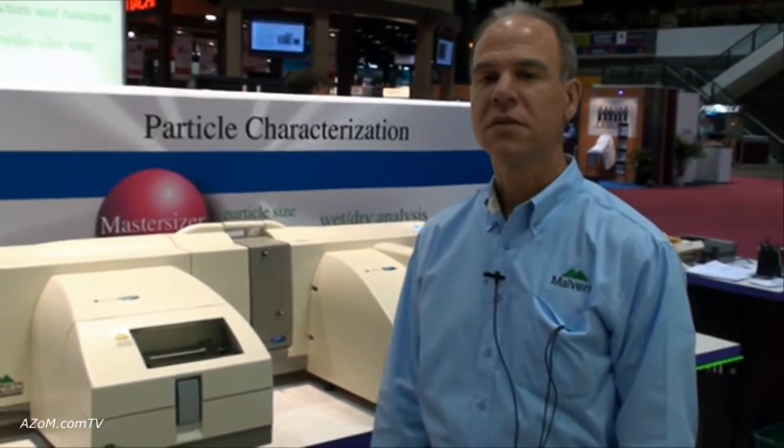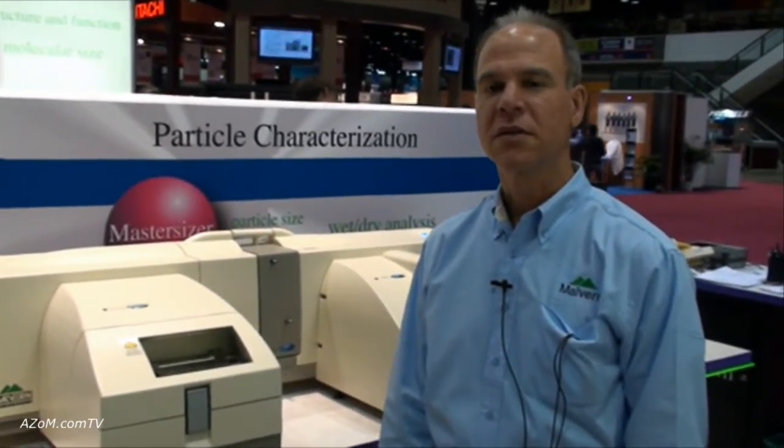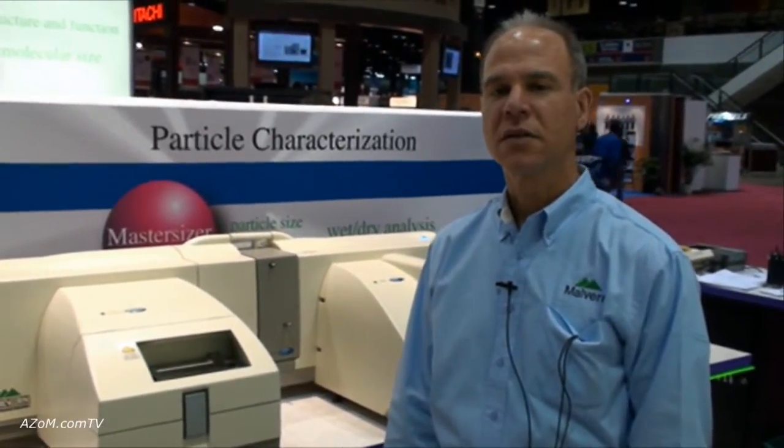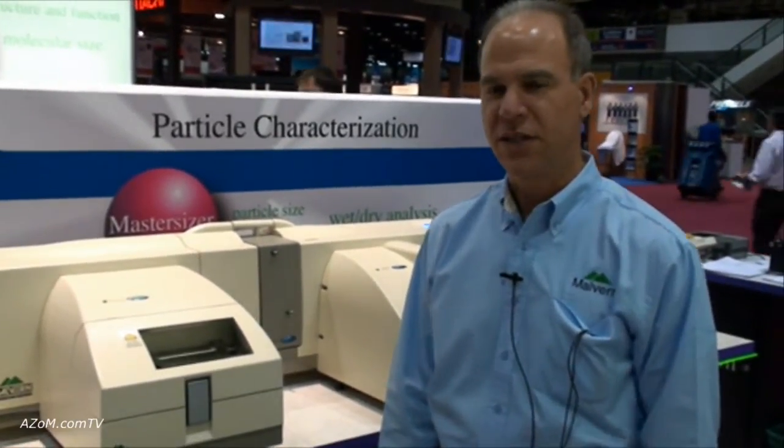This is Cameron Chai from azom.com and I'm speaking to Joe Wolfgang from Malvern Instruments. He's going to take us for a tour of the Mastersizer 2000 particle size analyzer. Thanks, Cameron.